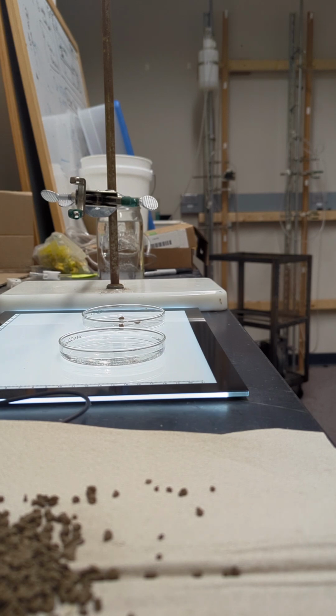So the best way, in my opinion, to measure aggregate stability is with an app that was put out by the Soil Health Institute. It's called the Slakes app. There's many other ways you can do it. There's all kinds of fancy contraptions you can buy from companies from all over the world. But with this free app, anyone is going to be able to measure aggregate stability. And I think it's a really good tool, and I didn't see a tutorial on YouTube on how to do it. So with no further ado, let's get into it.